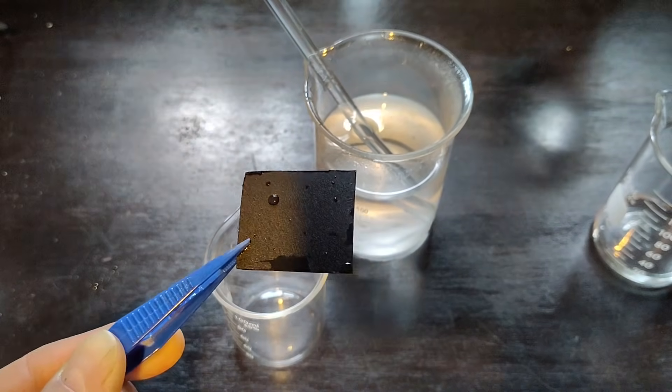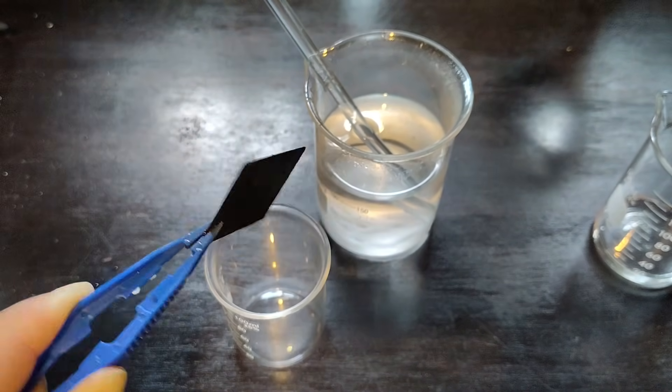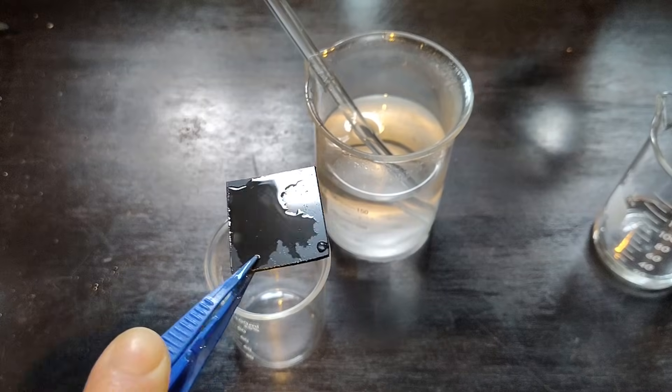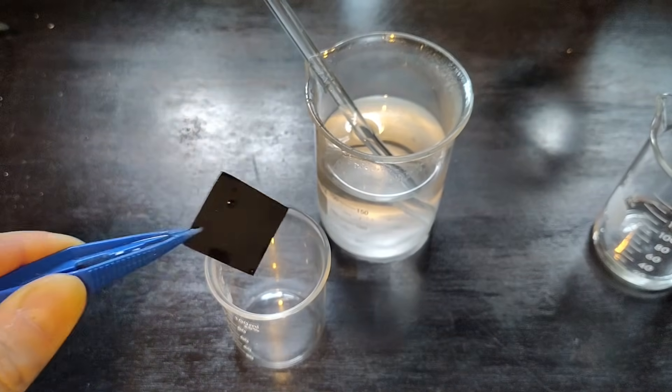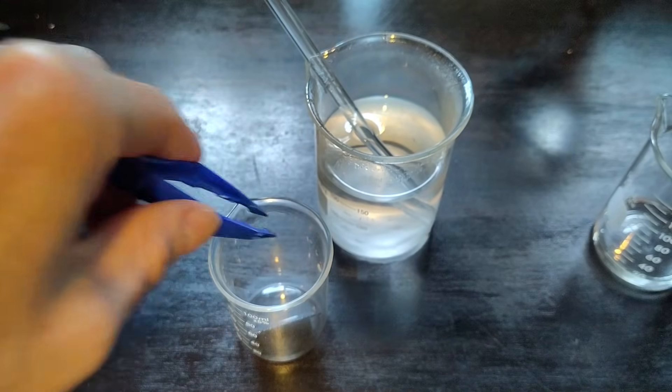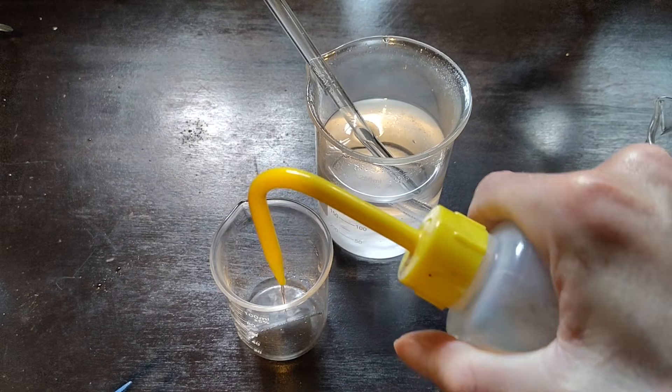And that's it. You have a proton exchange membrane. If you don't plan on using it right away, then you should keep it hydrated in distilled water.